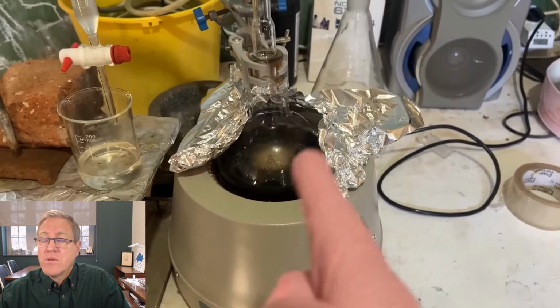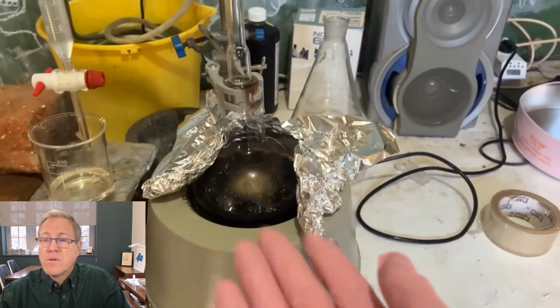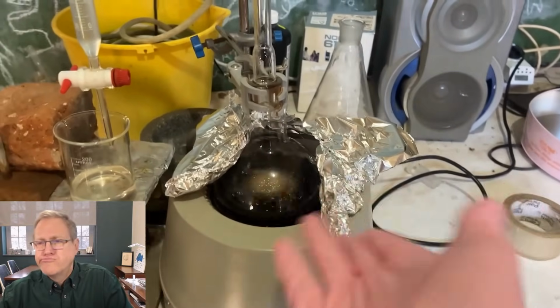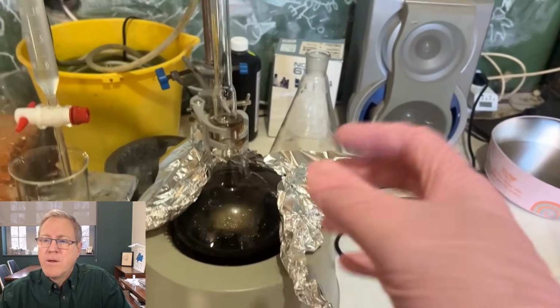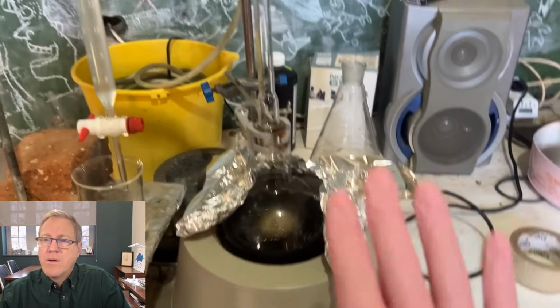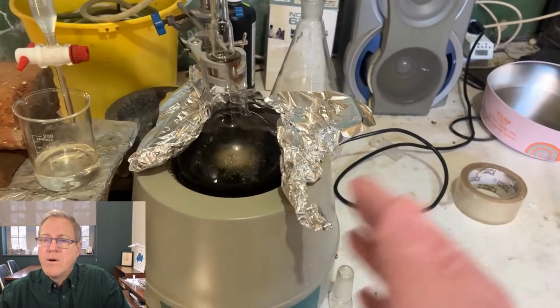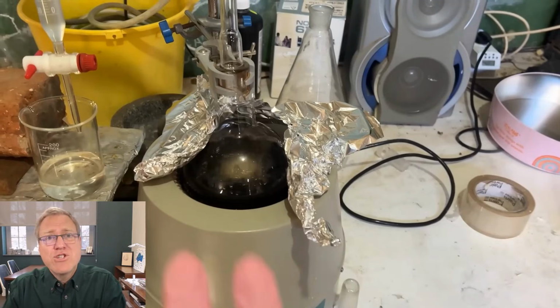What we don't want is, I suppose we don't really want to sit this reaction around in the acidic mixture because we're forming a ketal, which we formed by driving off the water. But if it's still acidic, which is quite acidic, we've got sulfuric acid in there, that sulfuric acid can really attack the ketal and break it apart. So once we've taken off quite a bit of toluene, we'll neutralize it. Then we really just want to go through a washing step to try and remove any leftover ethylene glycol, any leftover cyclopentanone.